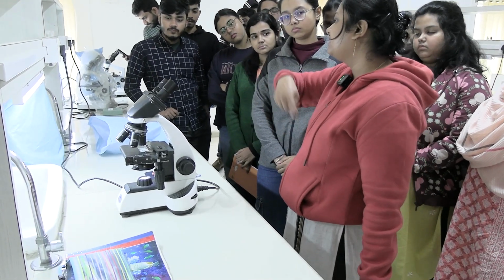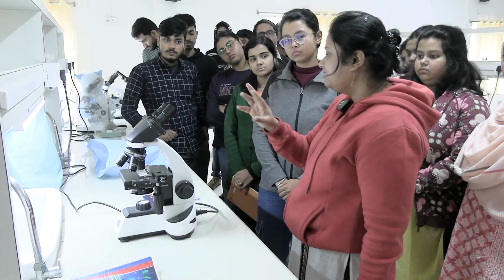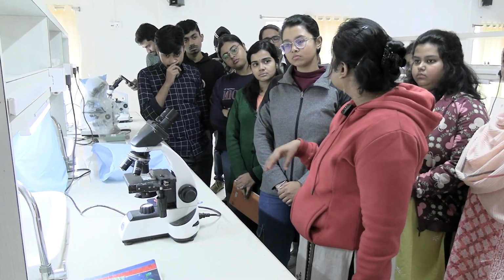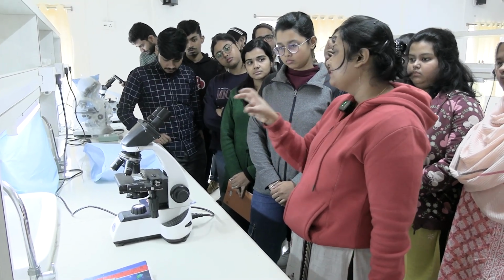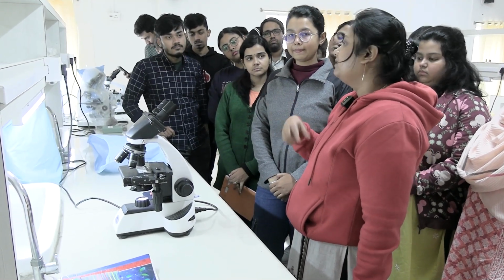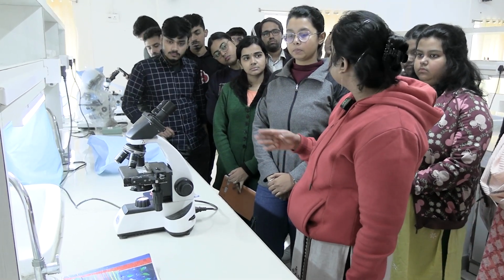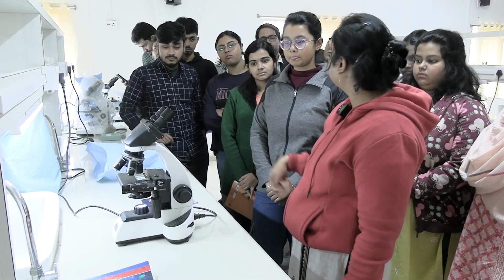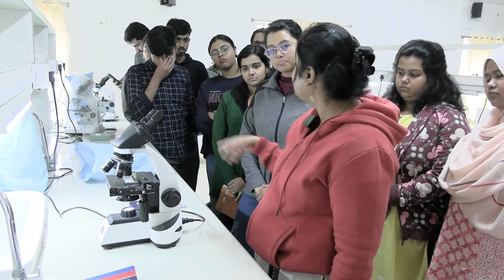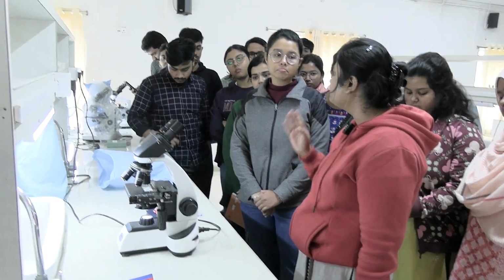After that, you see the cartilage layer. Cartilage is very prominent. You can see the chondrocytes lying in groups. Okay, and the matrix and lining perichondrium containing fibrous layer and cellular layer. Okay, and outermost is the adventitia, that is the connective tissue layer. And within this adventitia, you can see sections of some blood vessels.